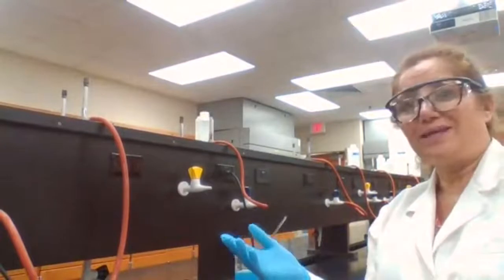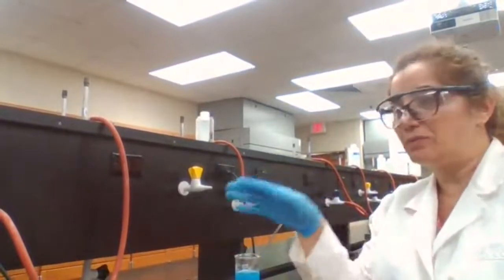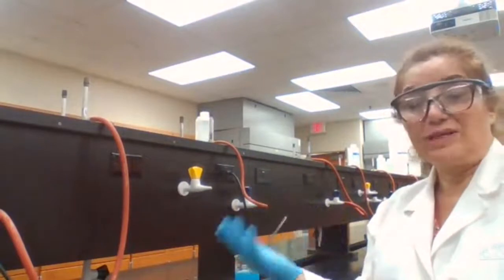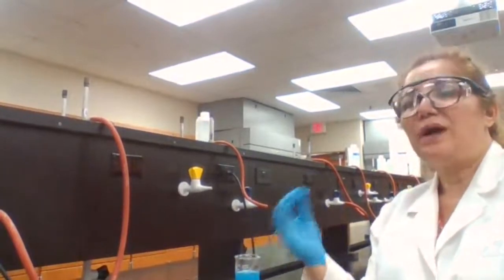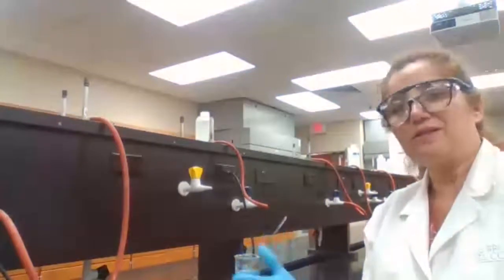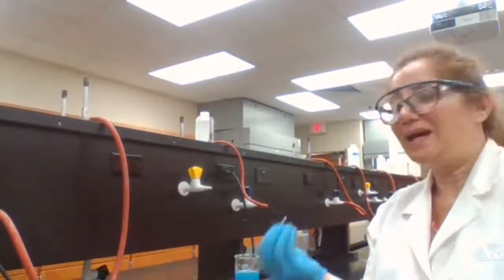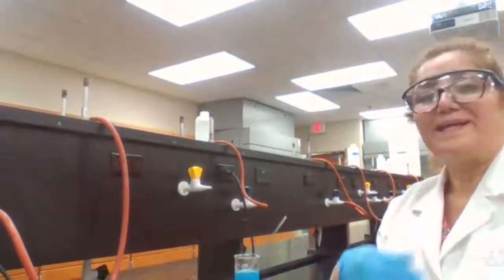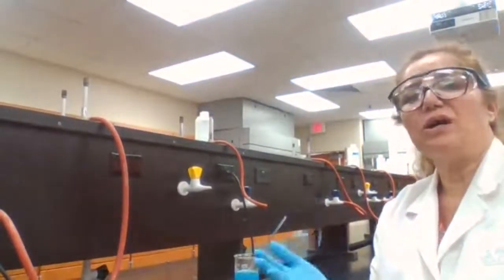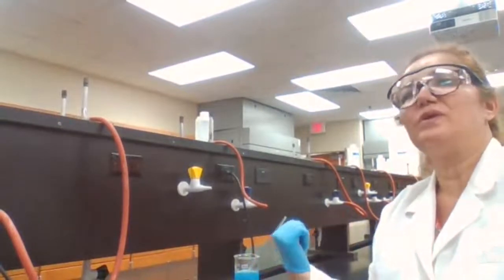Basically, copper nitrate, when it's in the solution form, you don't see anything because it's a clear blue color solution, transparent. But when copper changes to copper hydroxide, because it's insoluble, it will make the solution cloudy. And the cloudy solution that is forming is the indication that a solid compound has formed. And that solid compound that is forming here, we know is copper hydroxide.